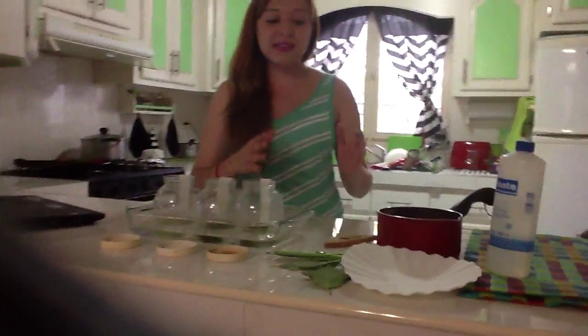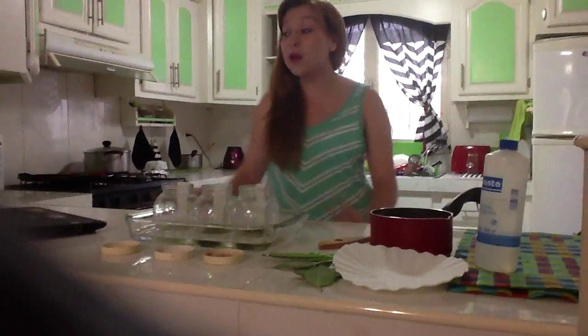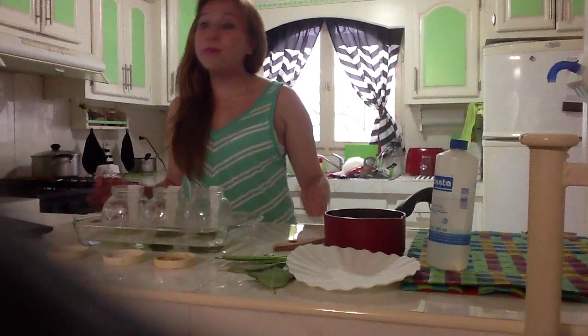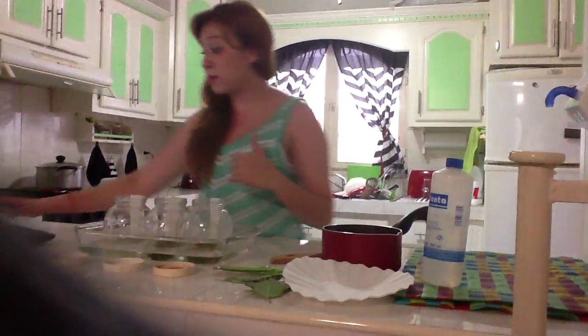Okay, so the step, after experimenting with the black inks and the different inks of different colors since last week, now this extra activity assigned for GT learners will be about pigments in plant leaves. In this activity, they will infer about the color the plant leaves will become in the fall. Okay? And I'm sure our gifted and talented students have wondered before about why the leaves change color and what are the hidden colors in the leaves.